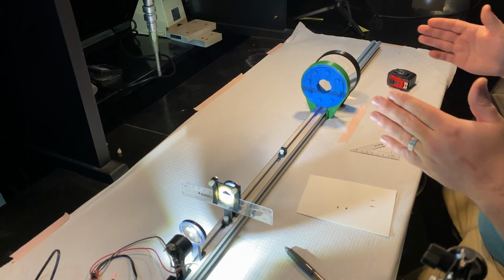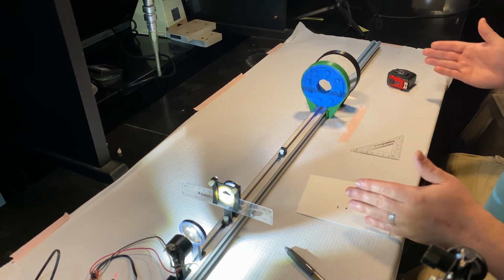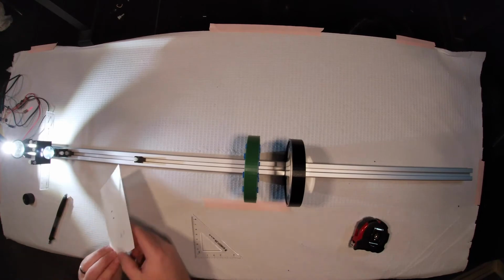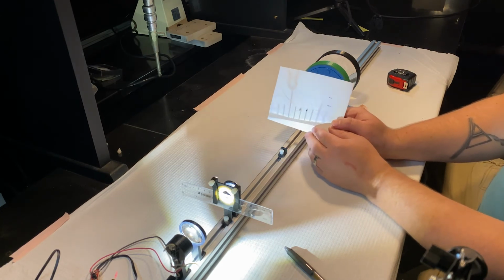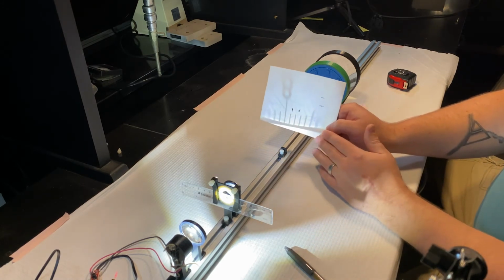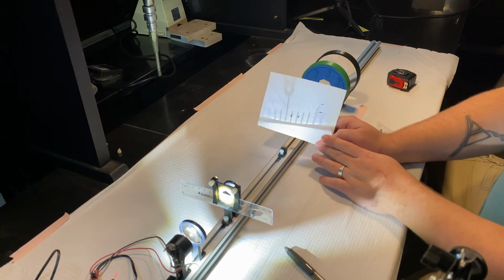All right, so what we're going to be doing now is looking at a setup with a multi-lens system where it's not infinity corrected, where we can look at conjugate image planes. So I have removed lens 2, and I have moved lens 1 now in such a way that we are now creating a real image. This is similar to what we did in the last lab. You can see that just with a single lens, we're creating a magnified image, right? And that's because our ruler is now mounted outside of 1 focal length of our first lens.